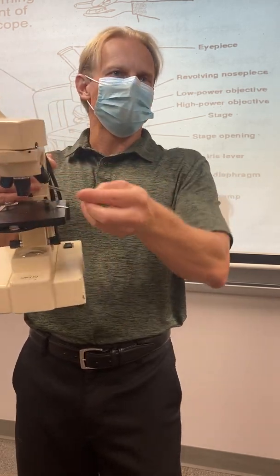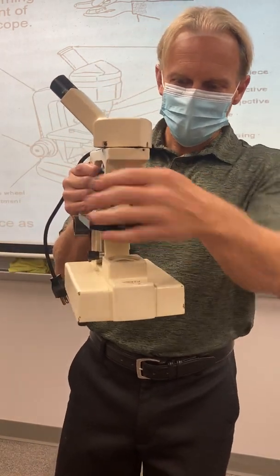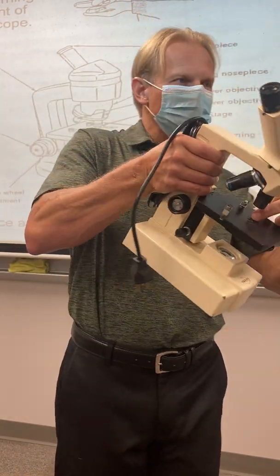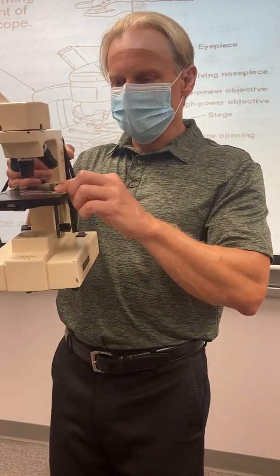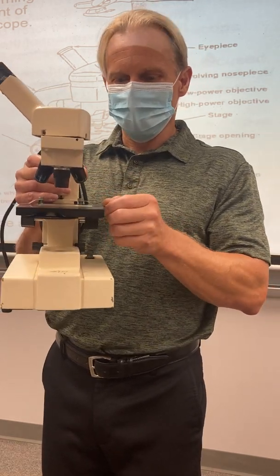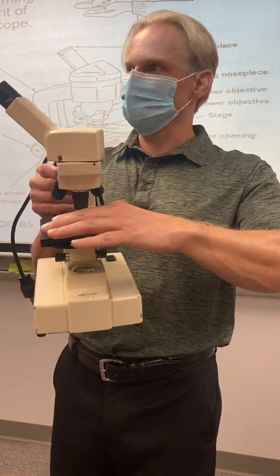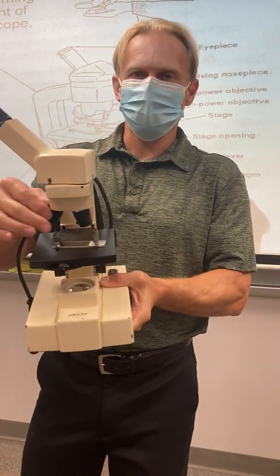It doesn't matter how the words are facing. Put it with the words up. And then what you want to do, it's easier with the light on, you want to make sure that little blue smudge that's on there is absolutely dead center of that little glass piece in the middle, where the light comes through. If it's not, it's going to be really hard to focus this thing. So we get that guy dead center, and then we can put the clips on. You can put one on, you can put two on, depends if you want or not, but don't lay the slide on top of the clips because you're not going to see anything, okay?